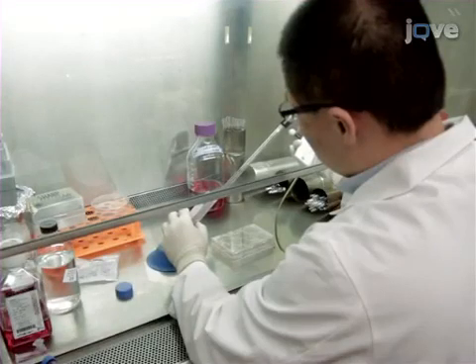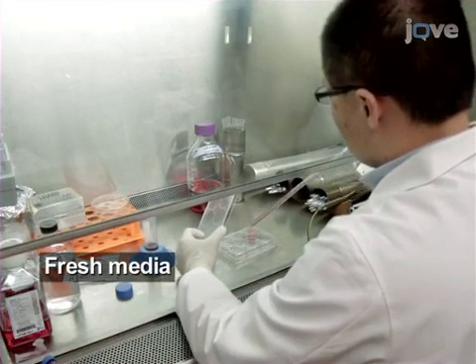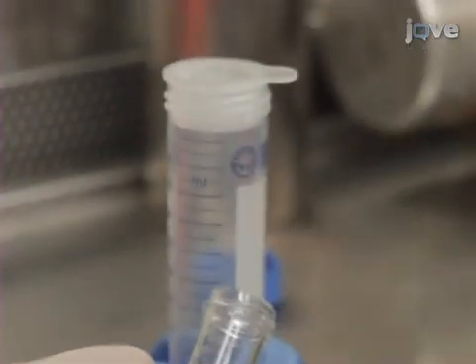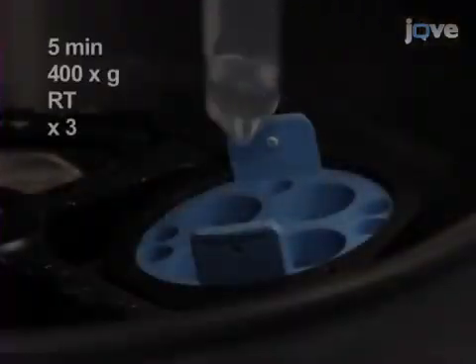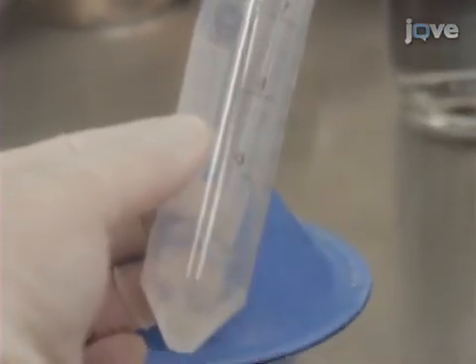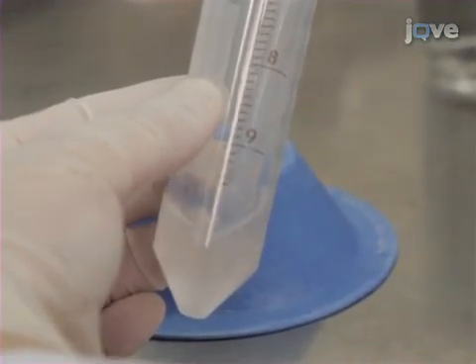On day 22, incubate detached iPS cells in fresh media on a new culture dish at 37 degrees Celsius for 30 minutes. Then remove about half of the floating cells and pass them through a 70-micron nylon strainer to exclude cell clumps, and wash the resulting single-cell suspension 3 times with cold PBS. After the third wash, resuspend the cells in PBS at 1.5 × 10⁷ cells per milliliter and maintain the cells on ice.